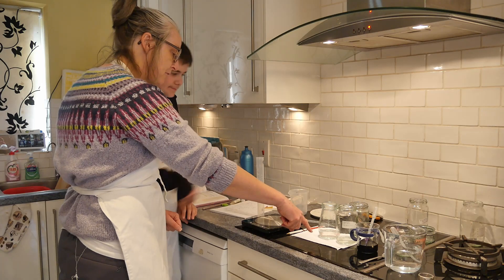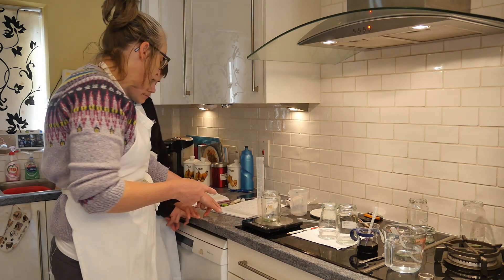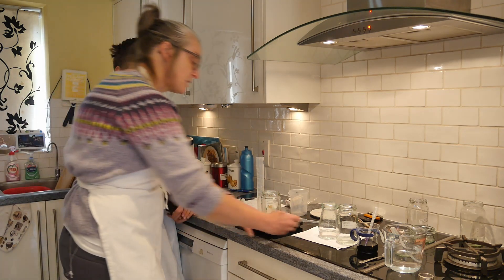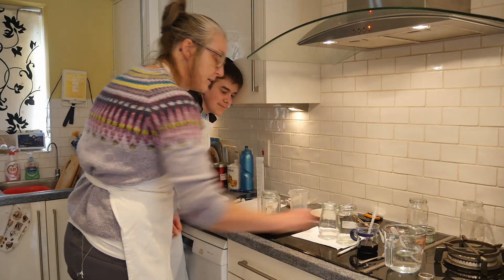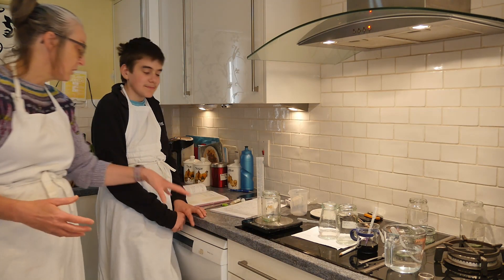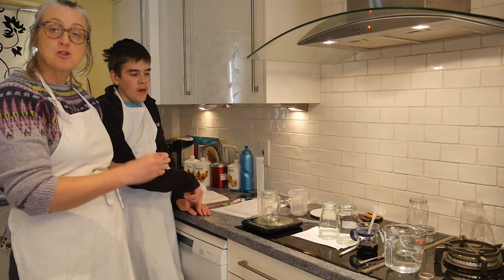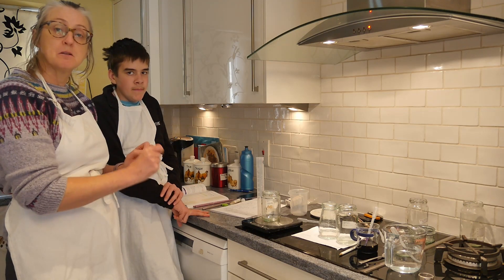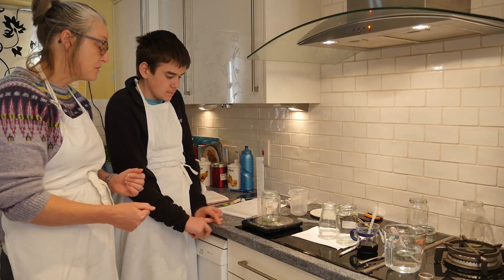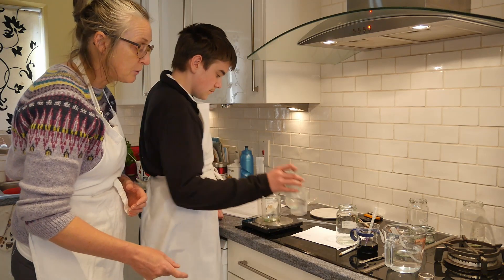Now we're going to do the same thing again — take out of the 0.5 molar solution into a fresh, clean, dry jam jar. We take out 25 millilitres and dissolve it back down to 50 millilitres, which gives us a 0.25 molar solution. The reason we didn't try to weigh that out directly is because doing these larger dilutions is far more accurate than weighing out minuscule amounts.